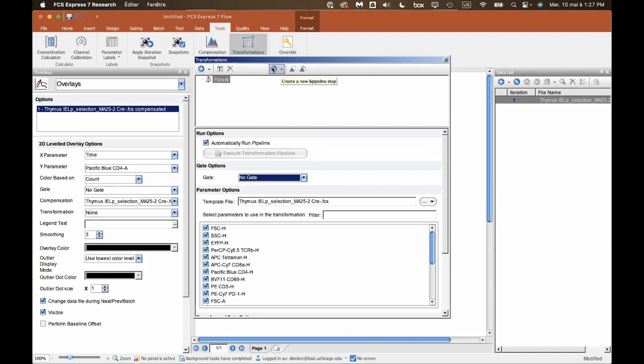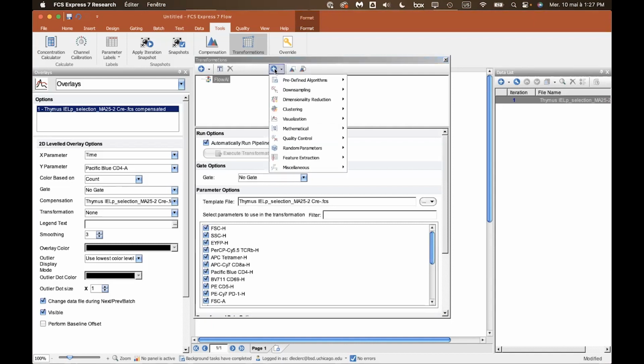Over here, we have a button, a plus icon, that will allow you to add steps to your analysis. You can do, again, a bunch of different things. We're going to use the predefined algorithms that we have over here: Flow AI, Flow Cut, Flow SOM. You can use any of them. Some of them do similar things in different ways. So that's why you need to be very aware of how you use these different algorithms. This is a bit outside of my own expertise. And so while I can easily plug in these algorithms in my analysis, it's really important that you figure out what they do and what changes with your data once they've been applied.